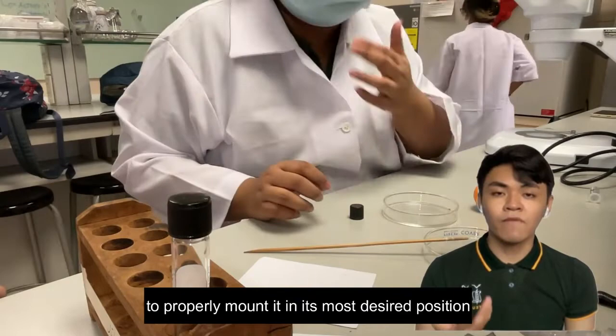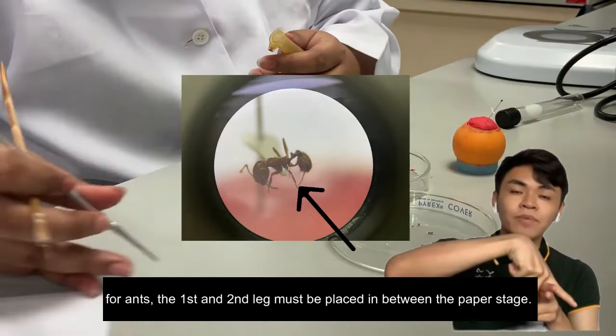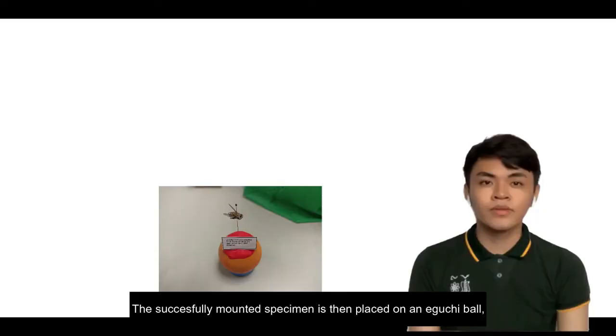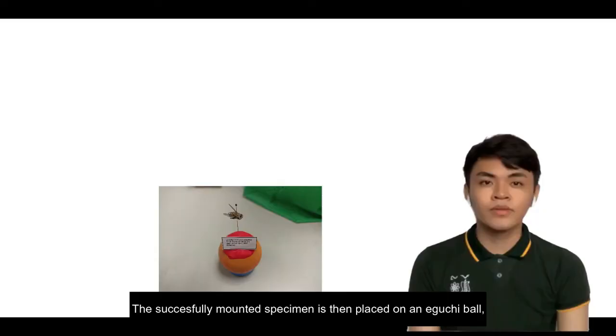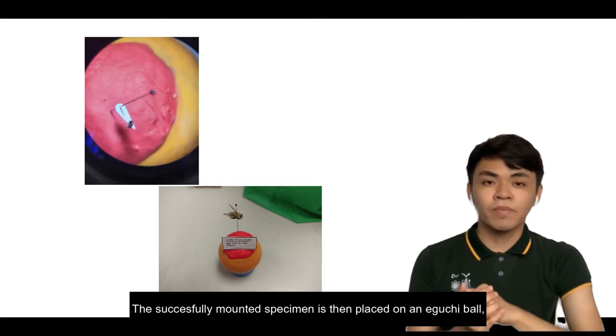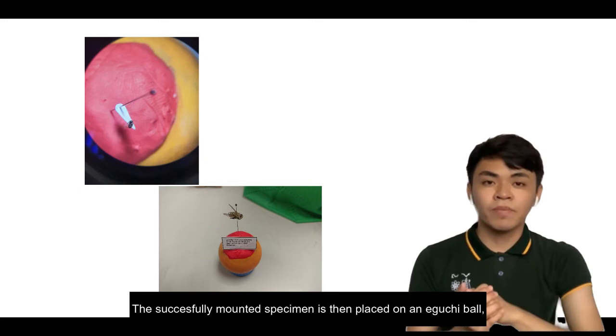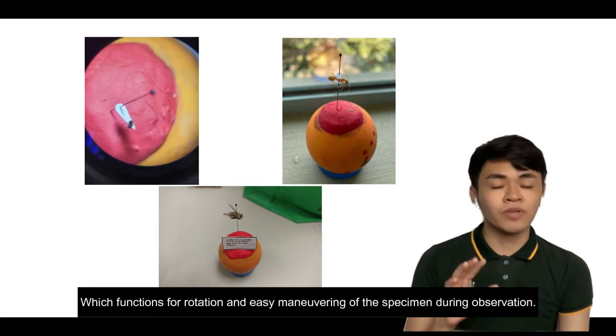The specimen is best oriented laterally with the legs and antennae facing the right. For flies, the pin must be pierced on the right portion of the thorax. For ants, the first and second legs must be placed in between the paper stage. The successfully mounted specimen is then placed on an eguchi ball, which functions for rotation and easy maneuvering of the specimen during observation. A dissecting microscope is then used to observe and identify the collected specimen.